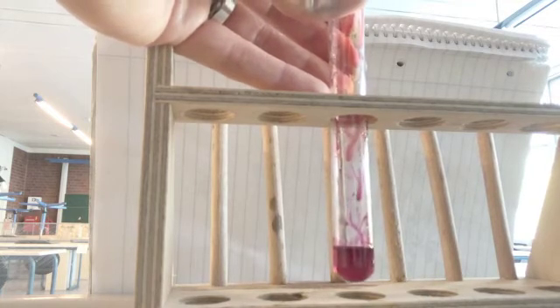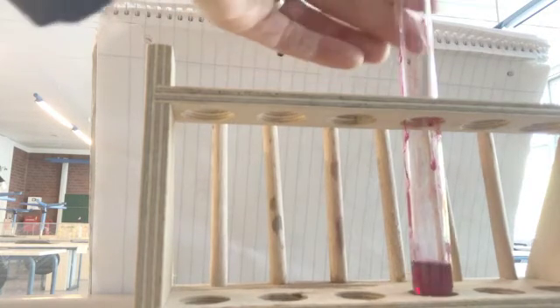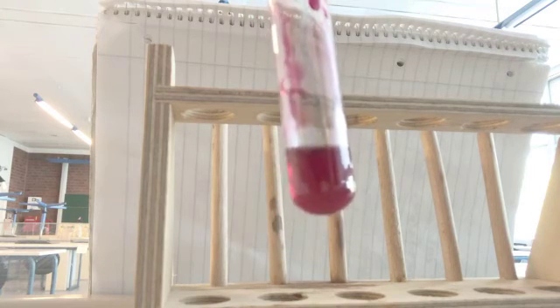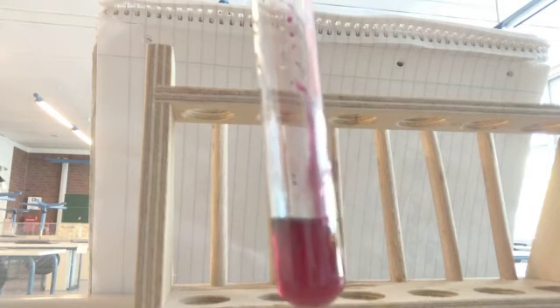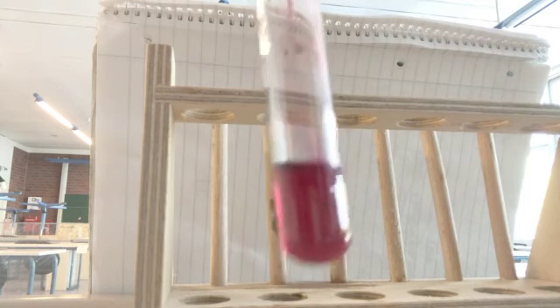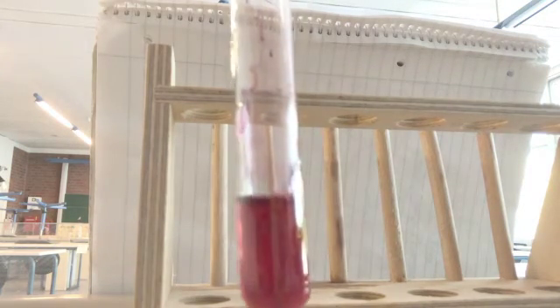So what color do you see? You should see a pinkish color with the universal indicator. And as I add this base now, you will see the color change. That color change is going to start moving towards being a base. It's still pink. I'm just going to do, again, some squirts in there. You can start to see on the sides of the glass maybe what color we should be expecting to see here in a moment.